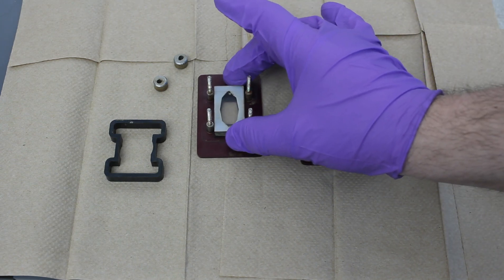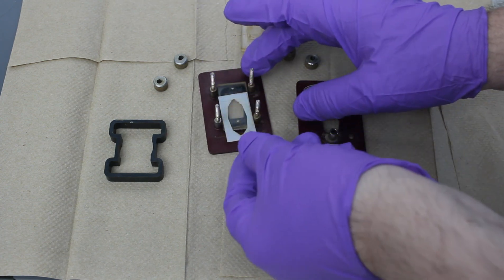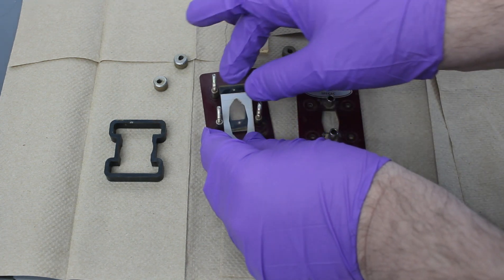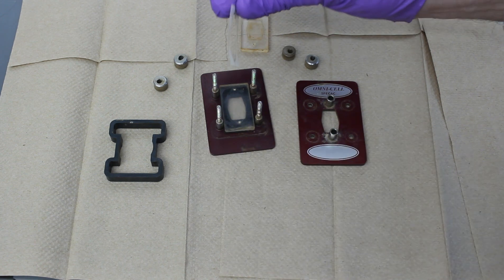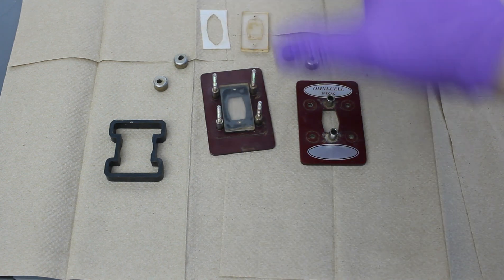So when you remove this, you want to be very careful because it's literally a fraction of a millimeter in thickness. So take that, put that there.